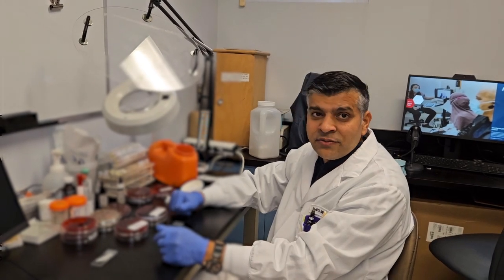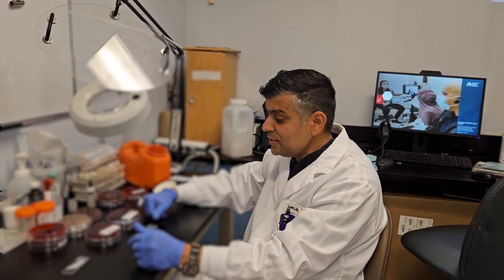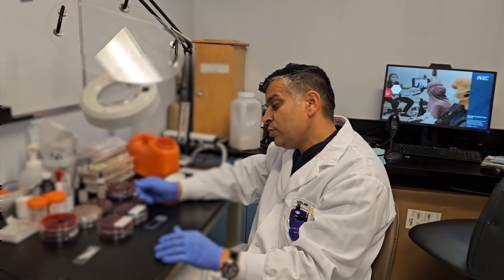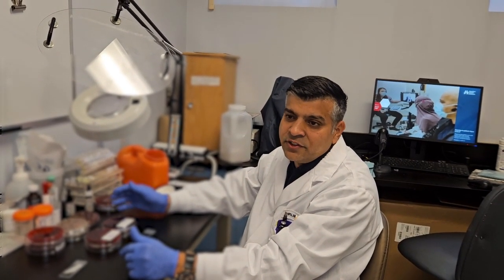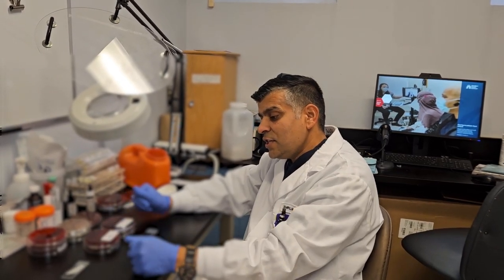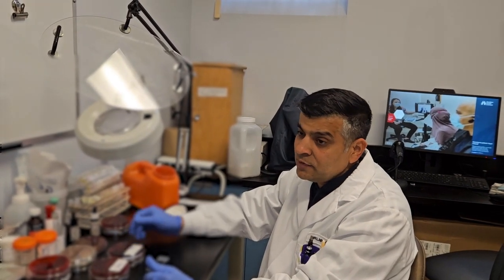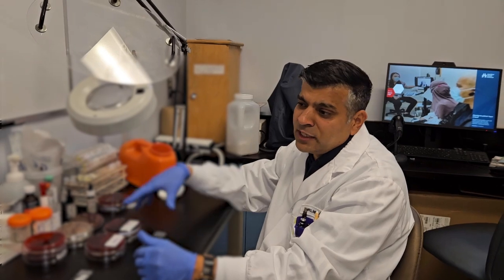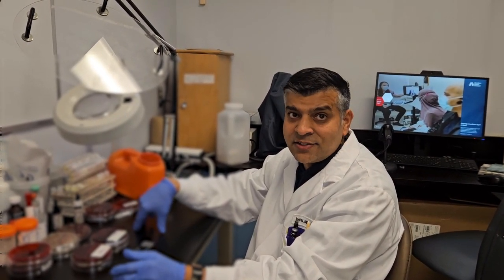I'm going to show you a few basic tests. The first one is the catalase test, and the second one will be the oxidase test. The catalase test is very popular in the routine lab. We do it every day to differentiate the group of bacteria called Staphylococcus from Streptococcus. If my test is catalase positive, I would think that's the Staph group, Staphylococcus, and when it's catalase negative, that will be Streptococcus. So I'm narrowing my identification to the Staphylococcus group versus the Streptococcus group by doing the catalase test.